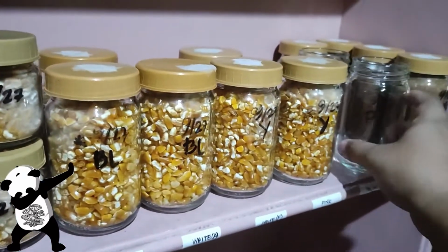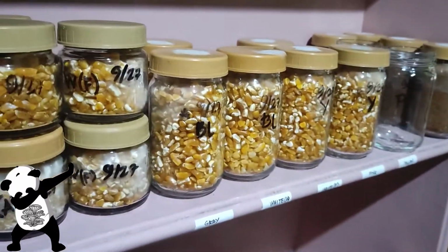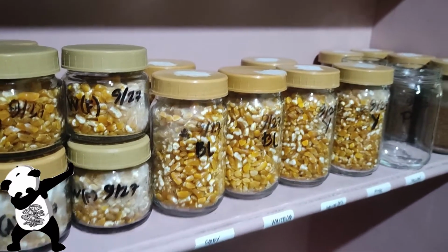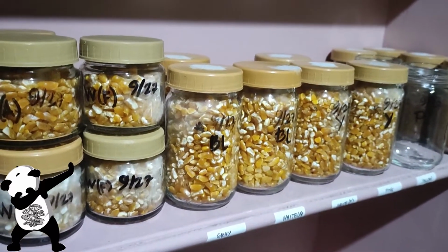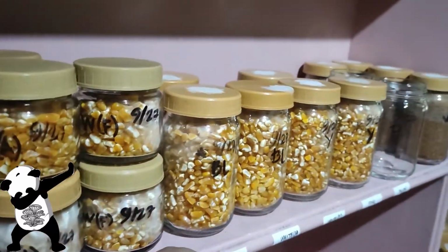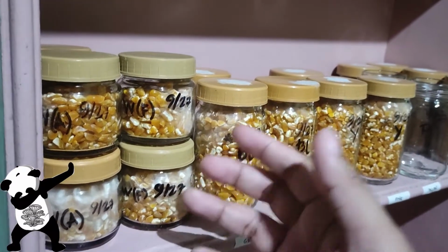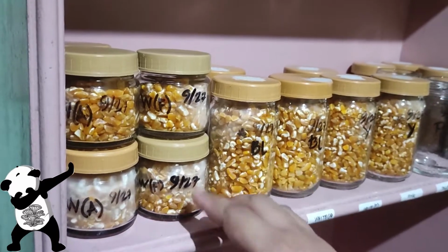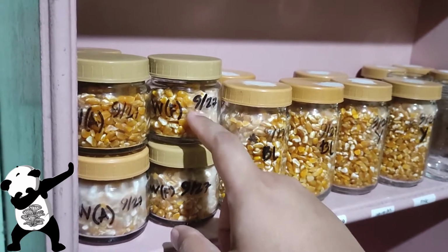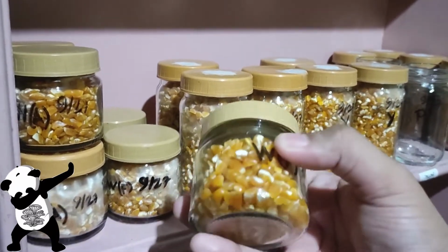The PDAs that I used here will not be used again, because results already show that even though it looks clean, there might already be some bacteria or contamination present. Anyway, moving forward, for tissue, since I'm having issues acquiring agar bars, I might be doing direct-to-grain tissue using a smaller container and a smaller amount of grains, and I'm going to set it up like this.